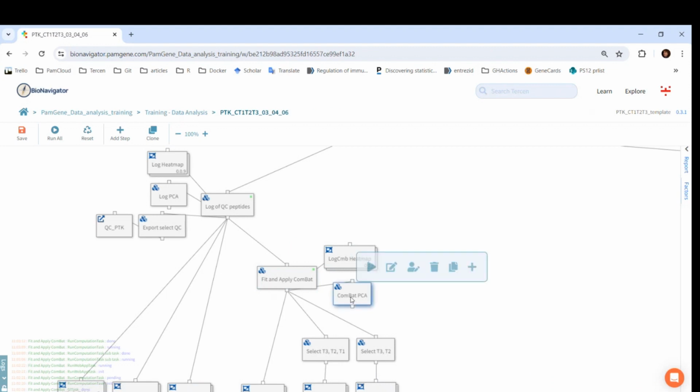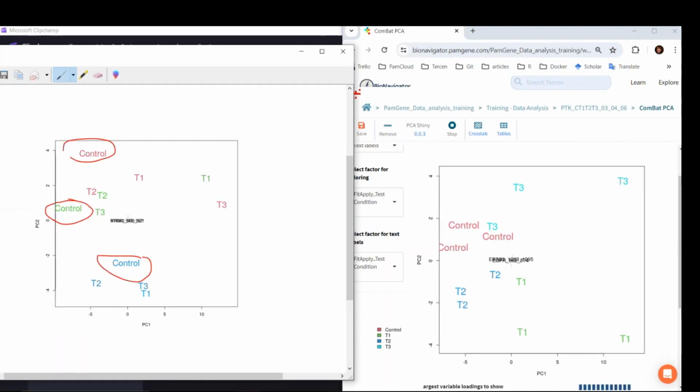Now the data that comes out of this step is Combat corrected. We can also check in the PCA how our samples cluster now. We can clearly see that conditions are better separated. You can compare the Combat PCA on the right side with the screenshot of the log PCA on the left side.